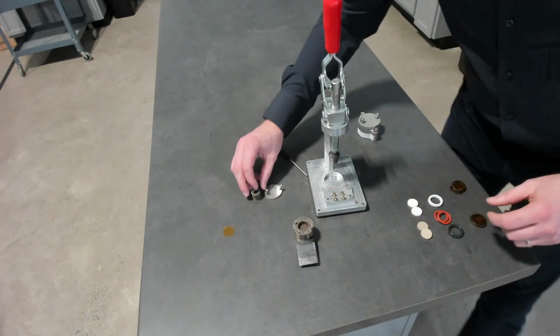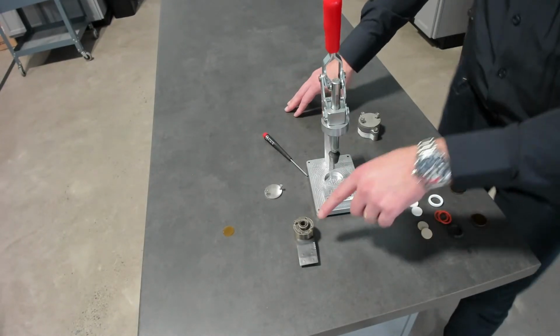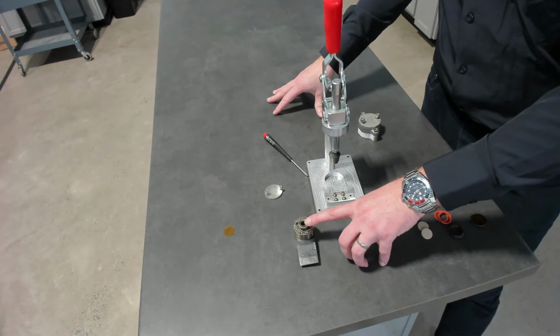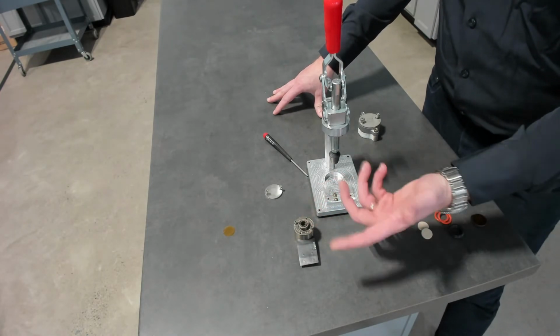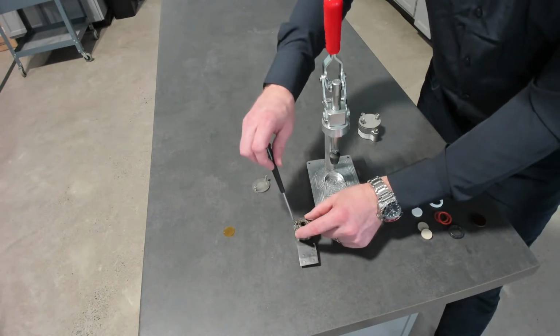And then we use springs. Each of these springs has different pressure. So you can have 3. There's actually a third one, and they have different forces. Depending on the viscosity of your sample at the melt, if it has very low flowability, maybe use more force versus less force. So we will assemble, we'll screw this together.